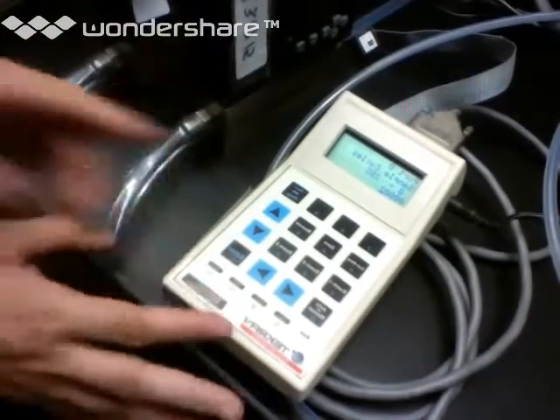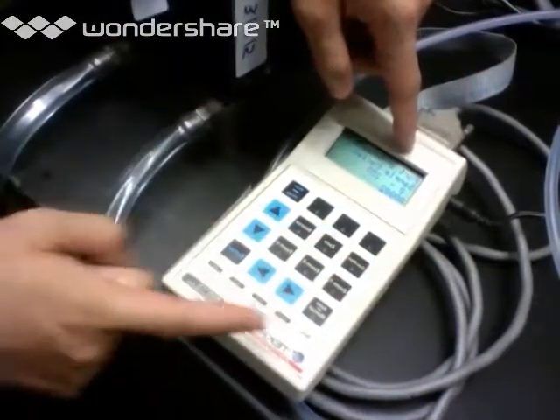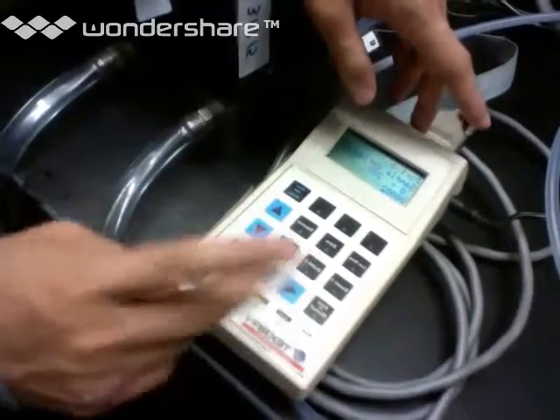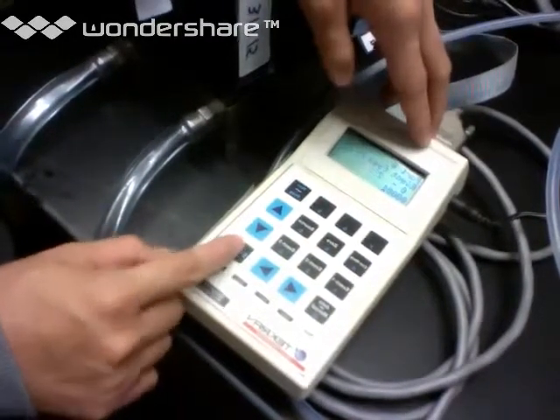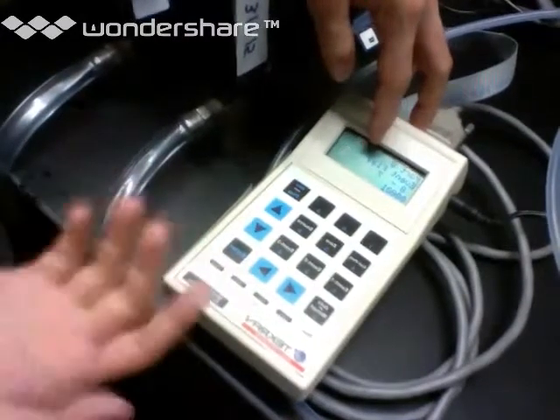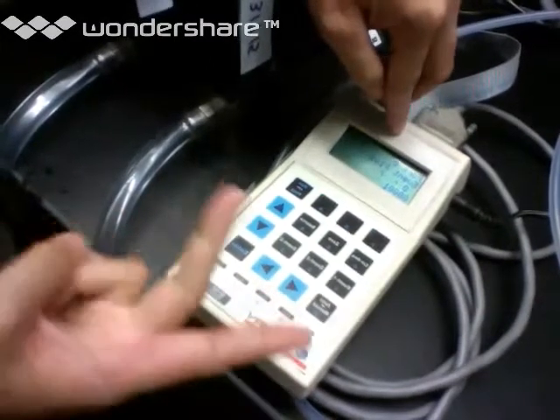Okay, so here we have the first screen that comes up. In port 0, which is the first actual port that's labeled on the 4-port sampler, we want 2 sample cycles for trap A and trap B. We don't have any flush cycles because we want more time resolution in our sample, so we prefer just to be continuous. And then the event flag, so that's why we call the numbers flags, because we're labeling port 0 flag 1. That's where we get 1, 2, 3, 4.